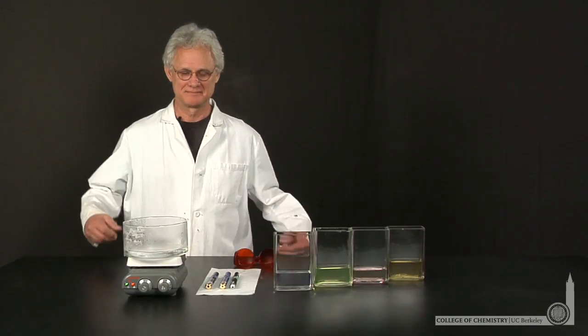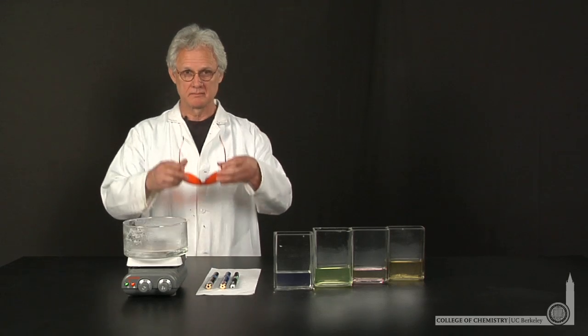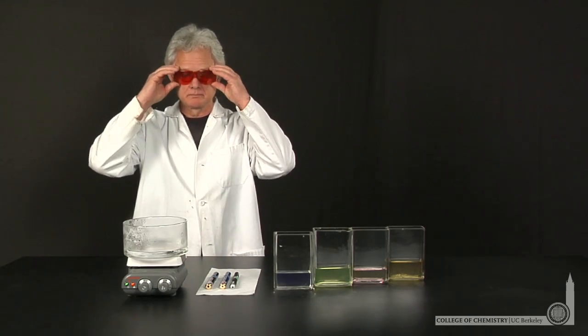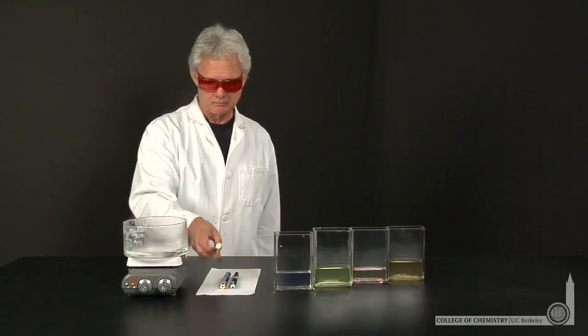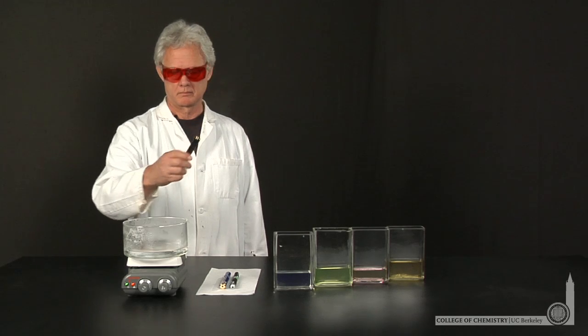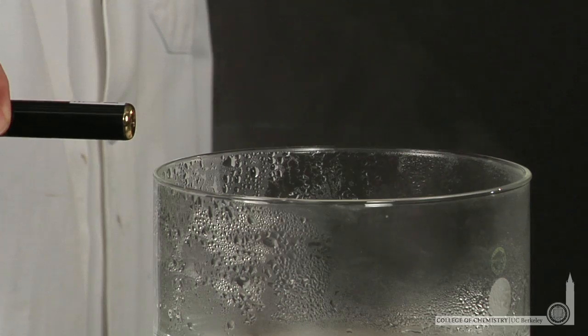Lonnie is in the demo lab preparing to demonstrate laser-induced fluorescence. Fluorescence occurs when high energy photons are absorbed and lower energy photons are emitted.